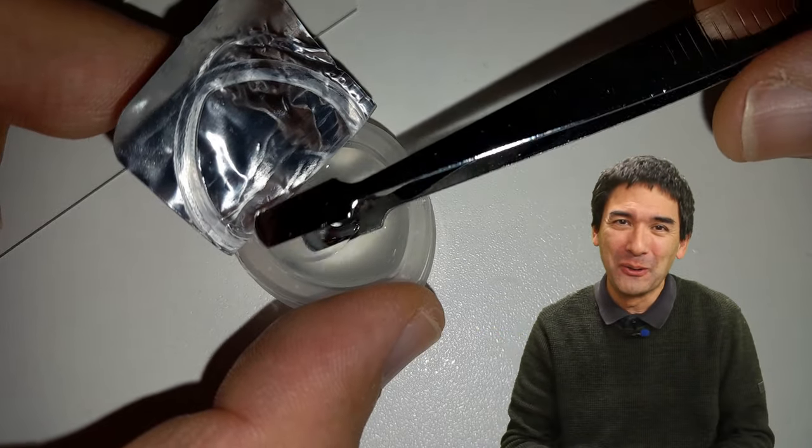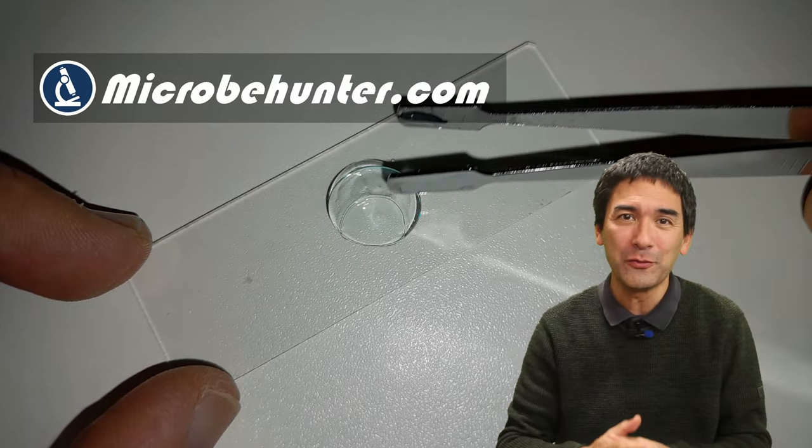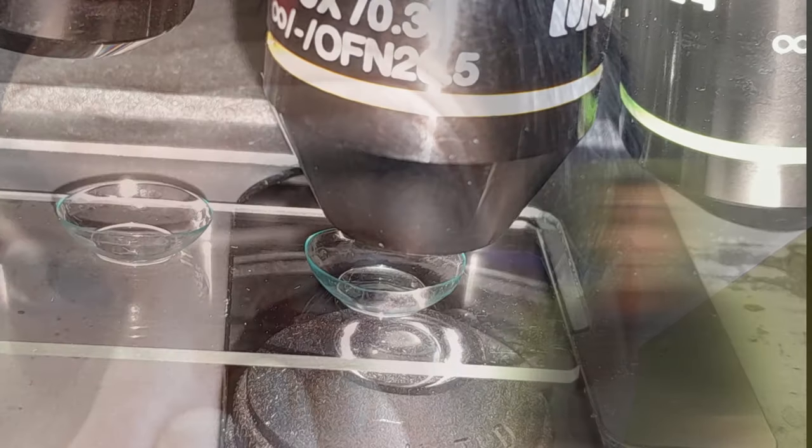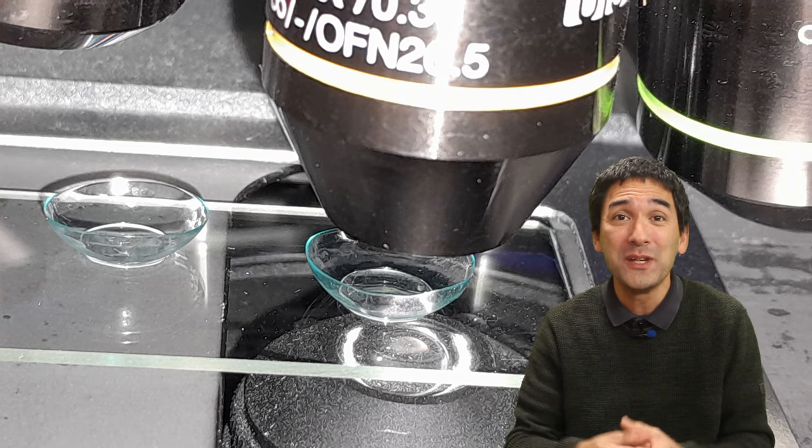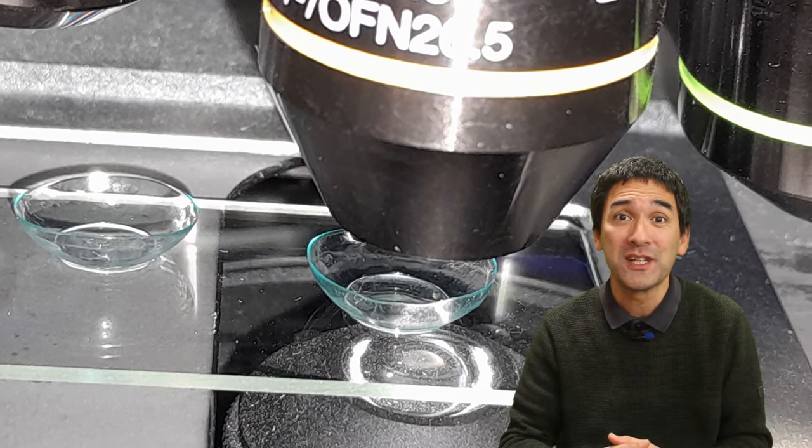Hello and welcome, MicrobeHunter here. You can see me now putting a contact lens under the microscope because I would like to see how old contact lenses are different from new ones, and maybe this helps us answer the question why it's important to change them on a regular basis. I've been wearing those contact lenses now for approximately one month and it's now time to change them again. I was given a pack of contact lenses that last me for several months.